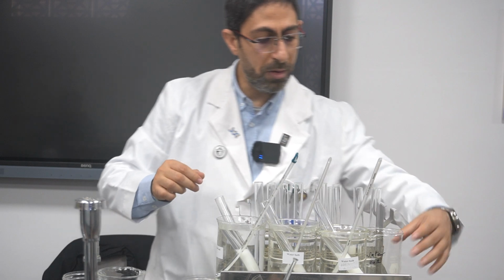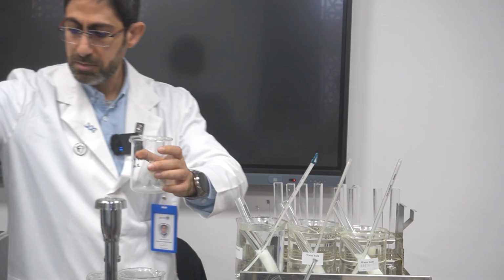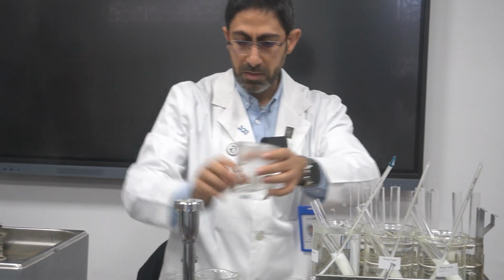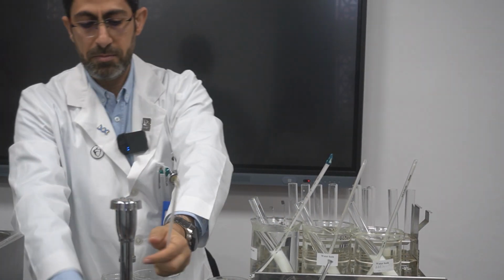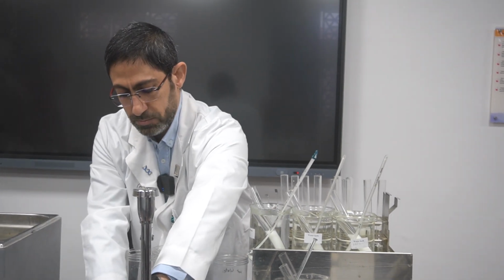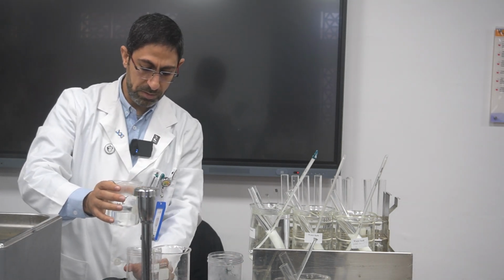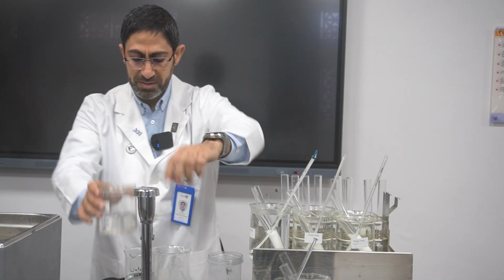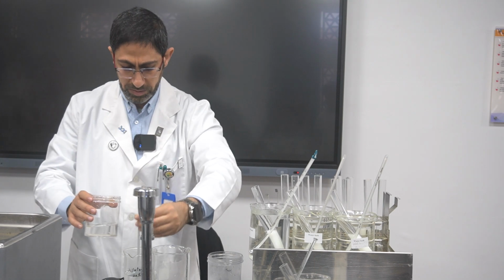Okay, here I will make it 30. I have to add small amount of the hot water, just small amount. Then I need a thermometer, please. Yeah, each one, please, with its own. Yeah, also for the stopwatches as well. Here is the hot water, tap water. I need more tap water. We still have a little bit of time. Here is a 20.